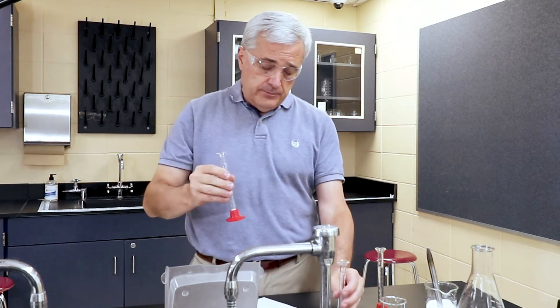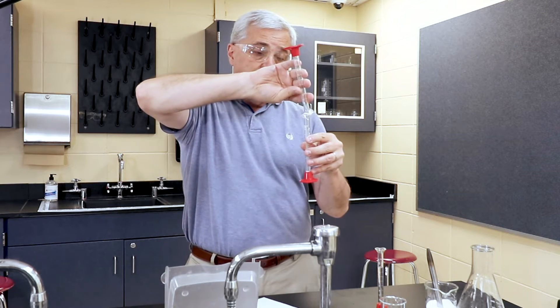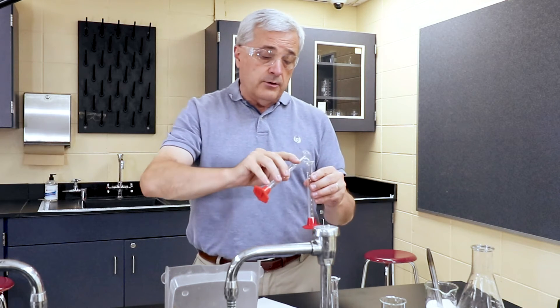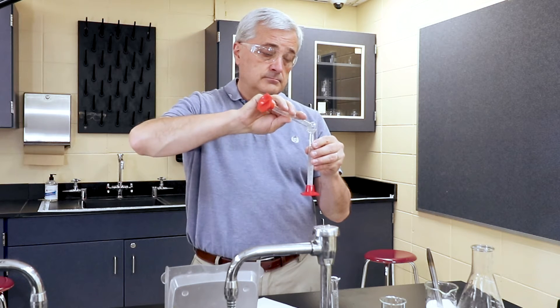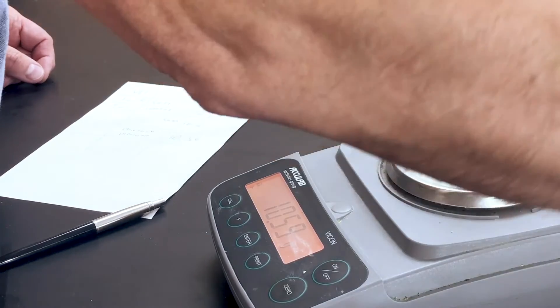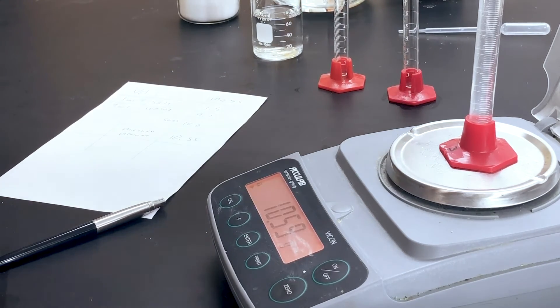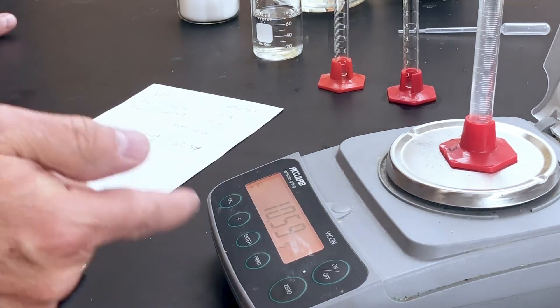All right, for the results, we're going to take the salt and put it in. So we get all of the salt into the third graduated cylinder. And we're going to put the liquid, the water — we're going to put that in as well. So we have one plus nine on the volumes. One plus nine. After we got all the water out of the water cylinder, we're coming up with 10.59 grams.